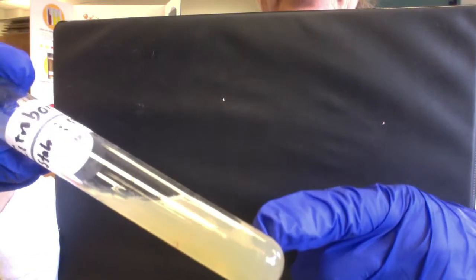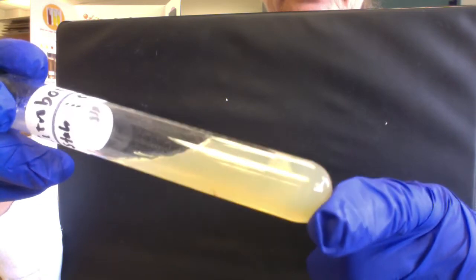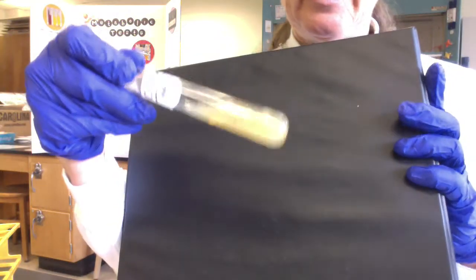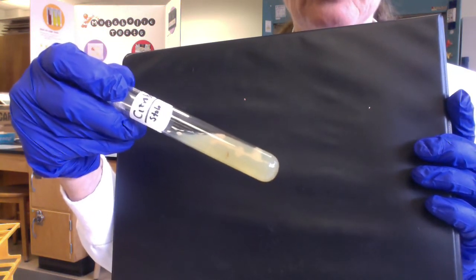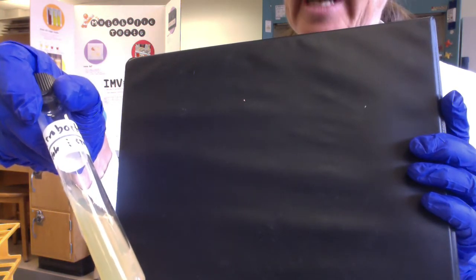In the butt where the Citrobacter is growing, there's cracks and bubbles. And that's because as it's growing anaerobically, it's carrying out fermentation and making lots and lots of gas. And those gases, they could be molecular hydrogen or carbon dioxide or both. So we know our Citrobacter is a good gas producer.